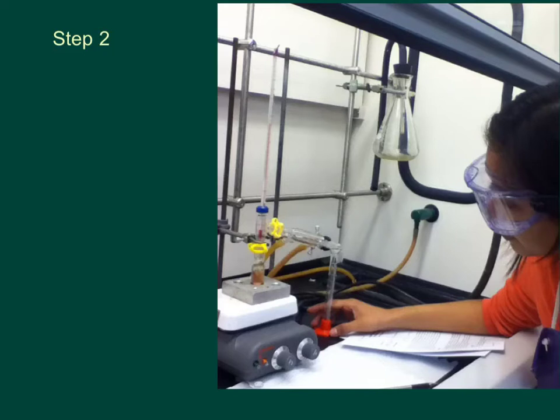From this picture, I just wanted to show you our water is going through this hose into the water-jacketed condenser, moving through and then coming out down the drain.